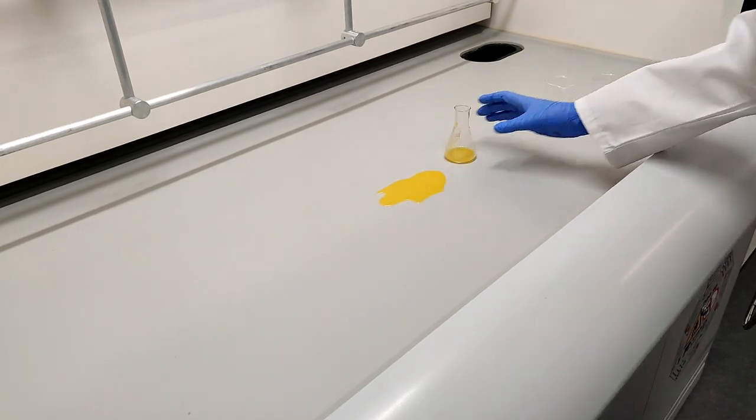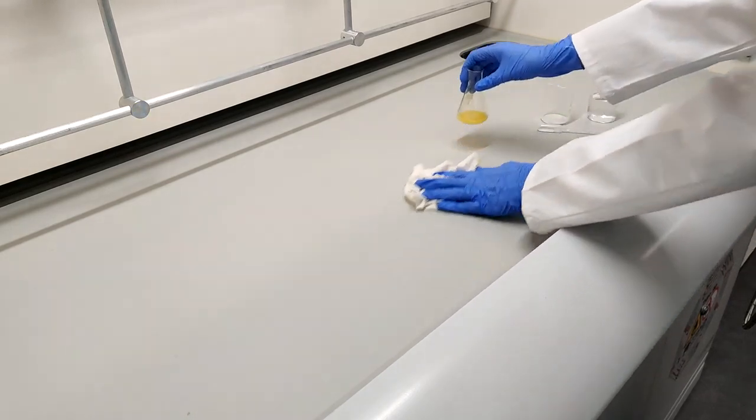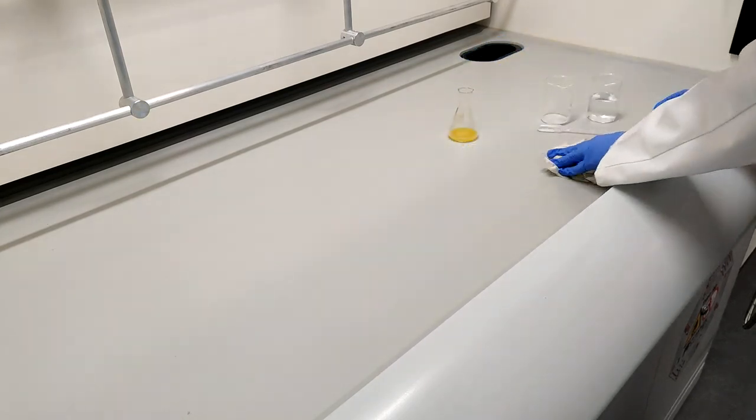Minor spills of low hazard liquids can be absorbed using paper towel, which should be disposed of as hazardous waste, preferably using a yellow bag. Spill pads can be used if paper towel is not sufficient or suitable for the liquid. The waste bag should then be taken to chemistry stores for disposal.